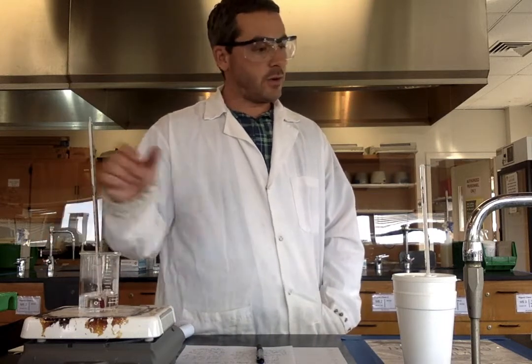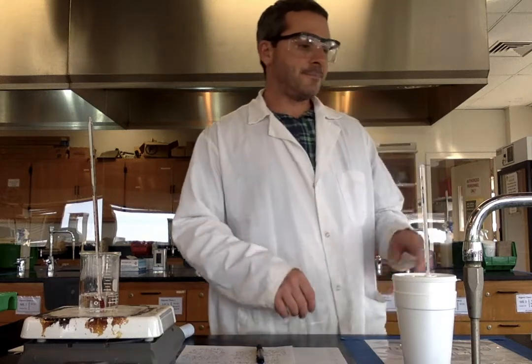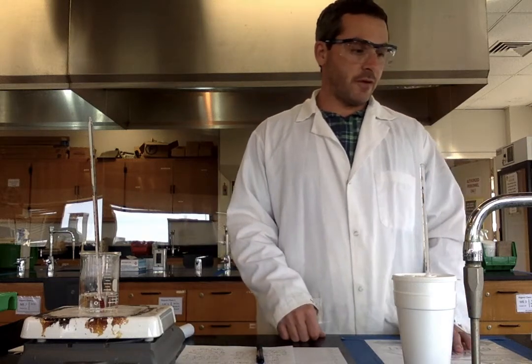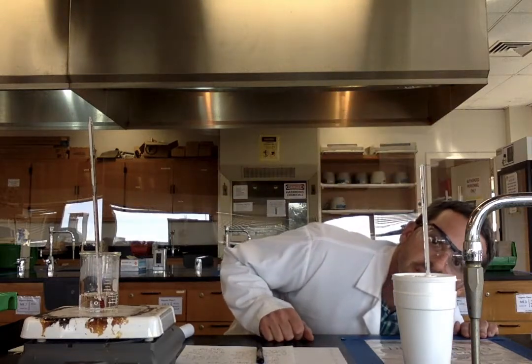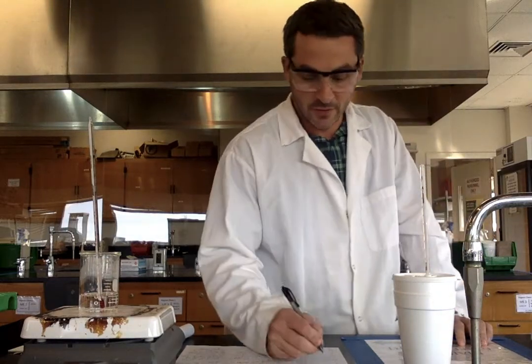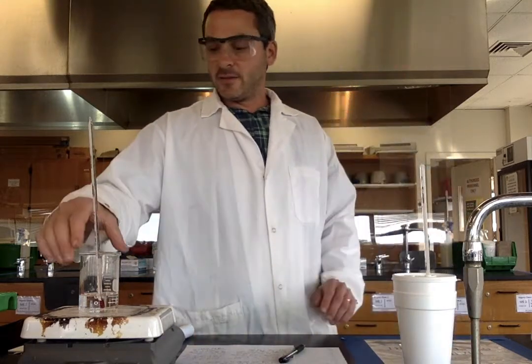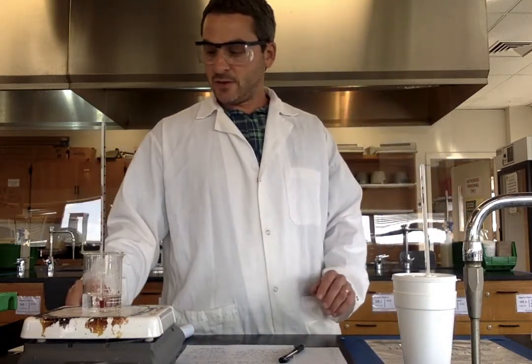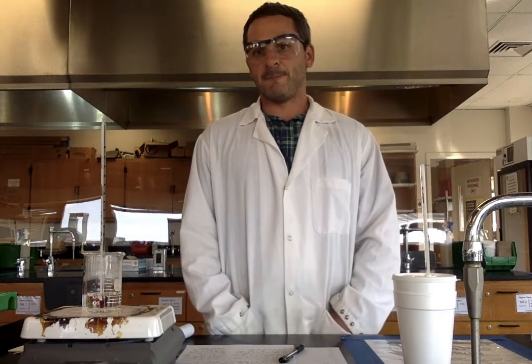All right, our hot water is almost all set here, and my cold water is just going to hang out for 1 more minute. So I'll take another reading. Pretty sure it's going to be 24.0. So we got 1 more minute. This is almost up to 70, which is what I wanted to see. Perfect timing. And then we will mix them together and record the data there.